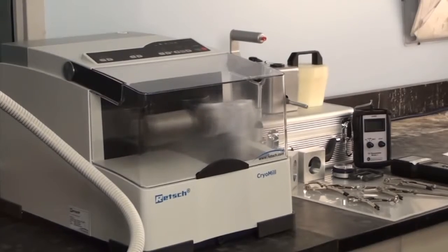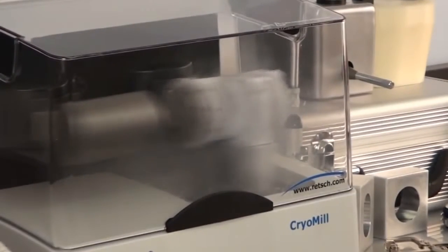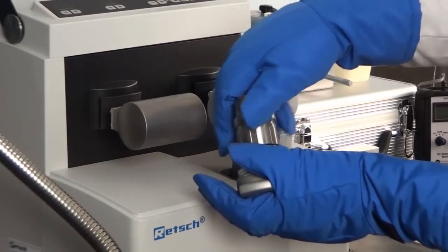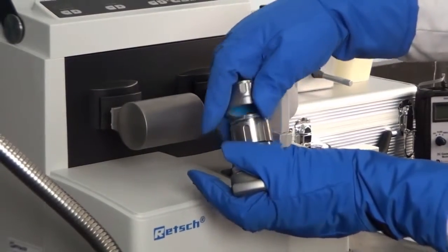The sample will be agitated vigorously until the ball bearing homogenizes the plastics. When this process is complete, the technician will wait for the instrument to warm up and he will take the vessel off.